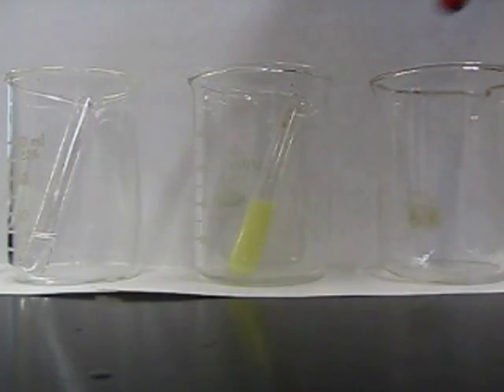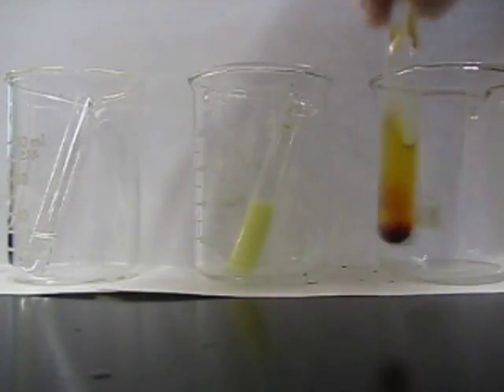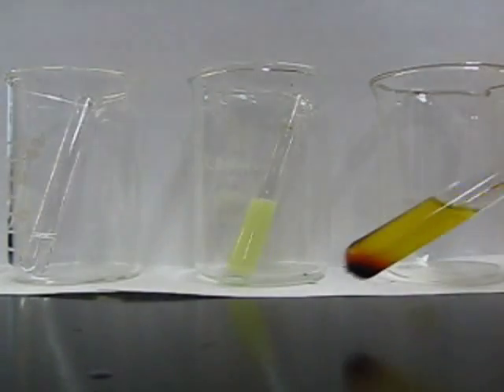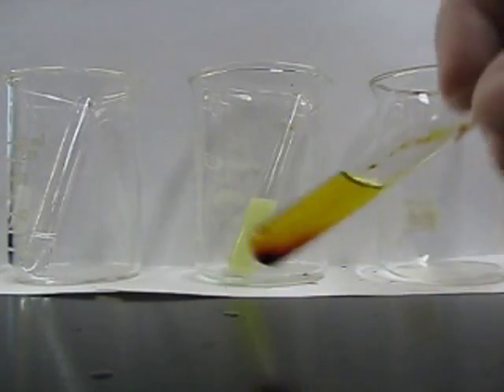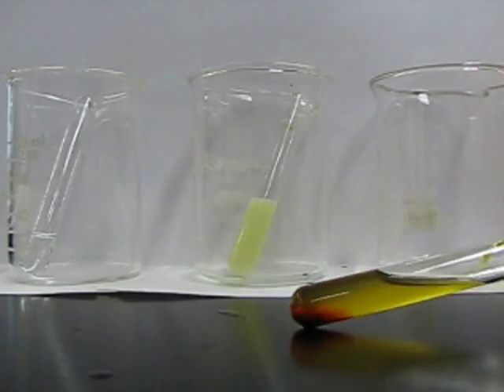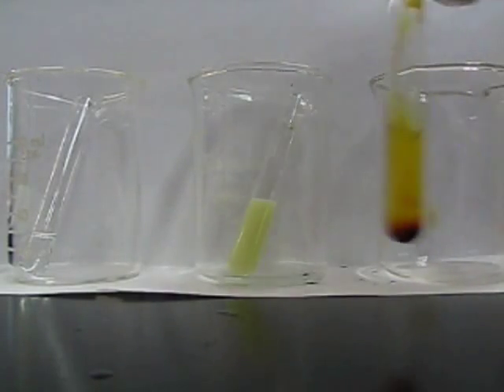Now, in the one case in the middle, you can see that it's not very transparent. It's a pretty cloudy yellow color. In the test tube we're looking at right now, even though it's colored because of the iodine, it is fairly transparent. And that's the big difference here.